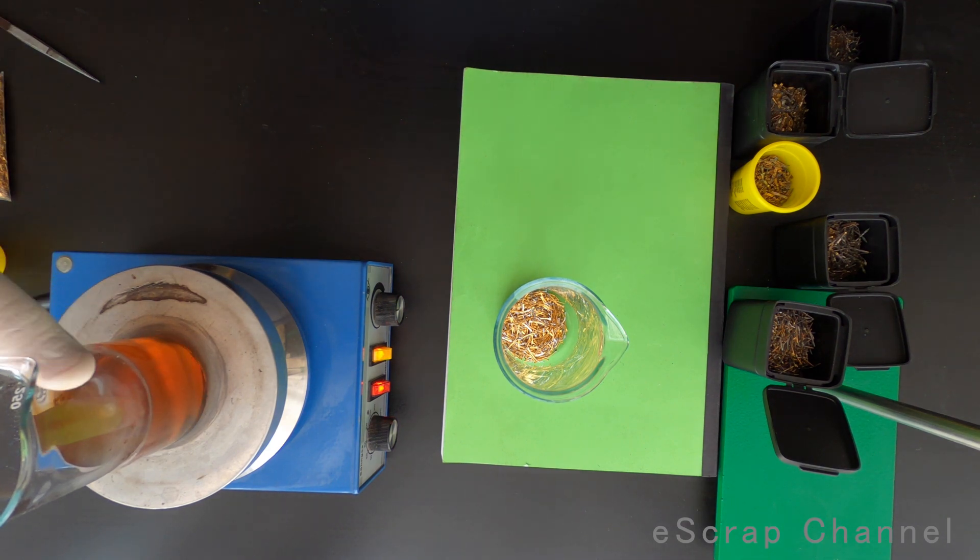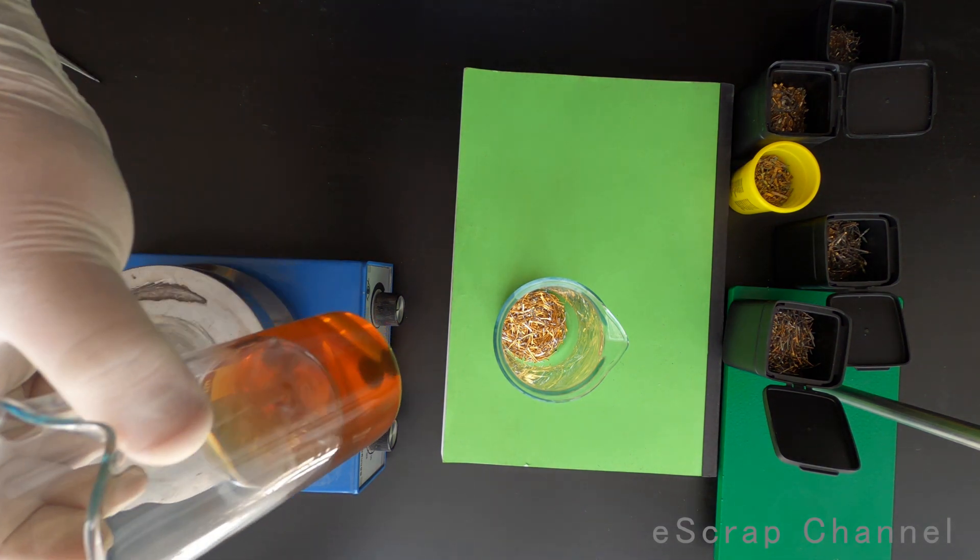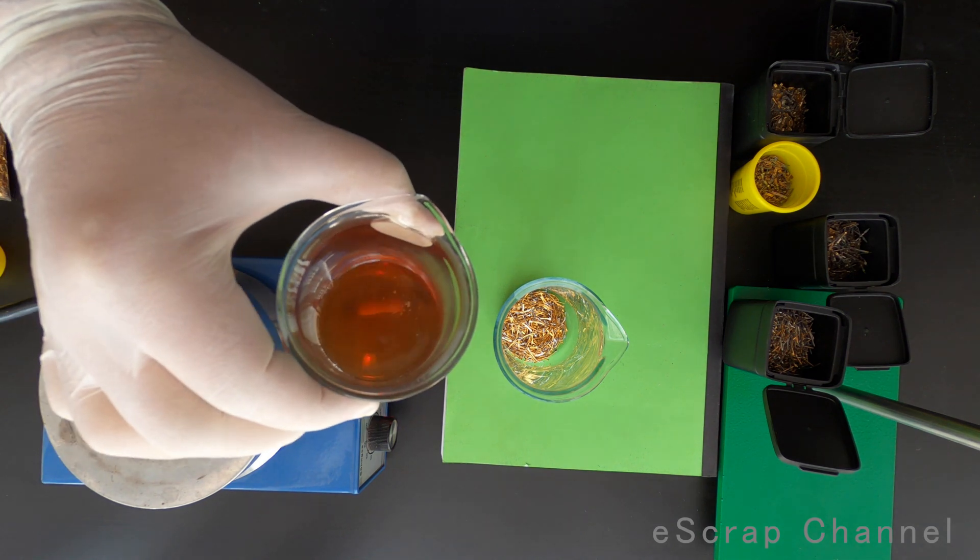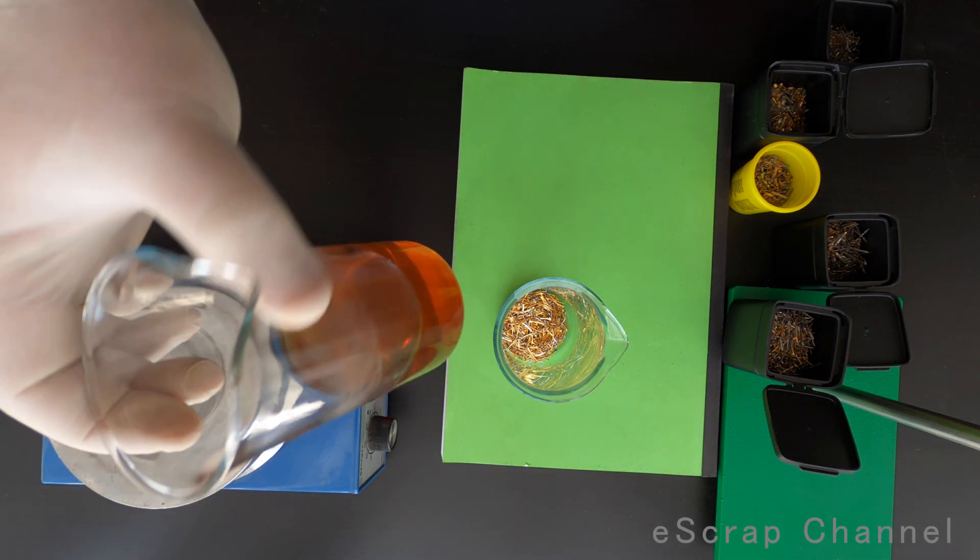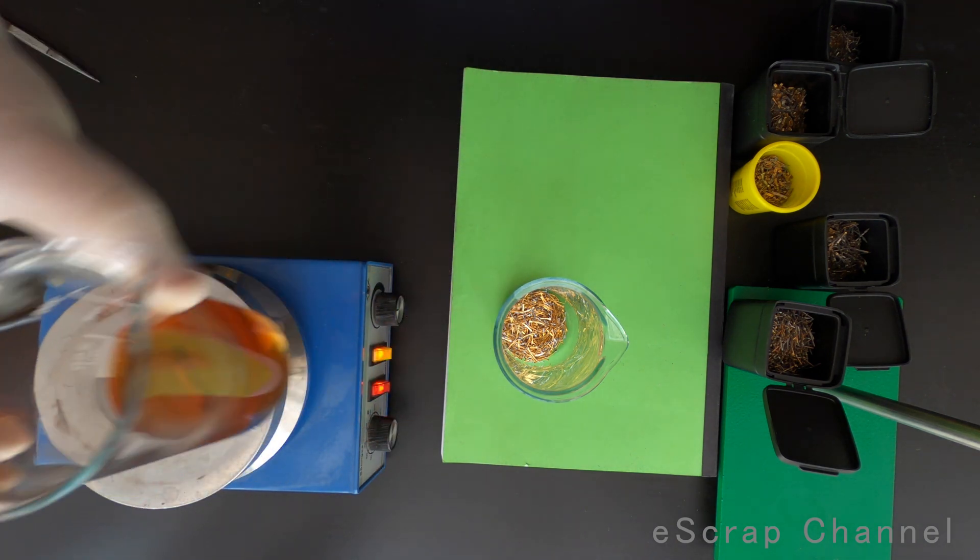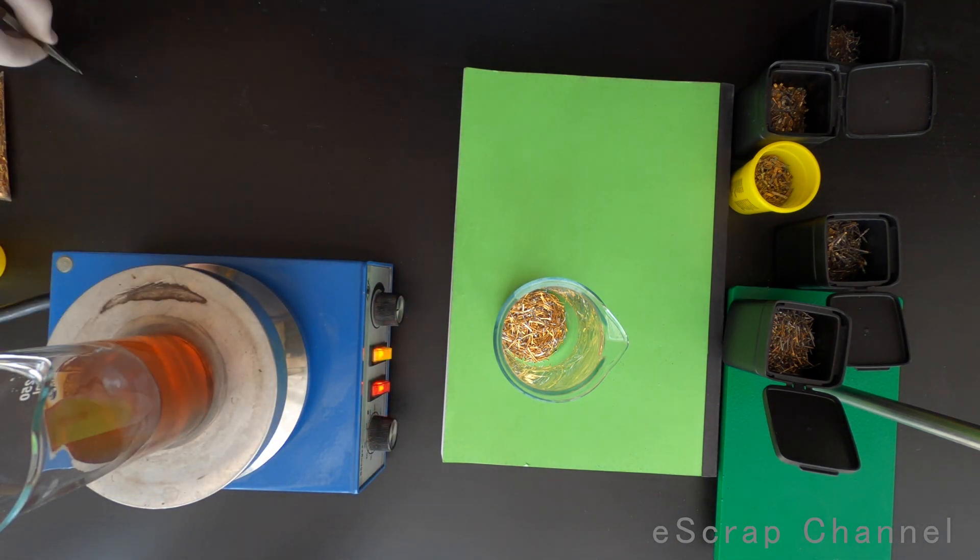After 30 seconds, we have the solution. It has a brown-red color. And actually, let me show you something that is really interesting here.